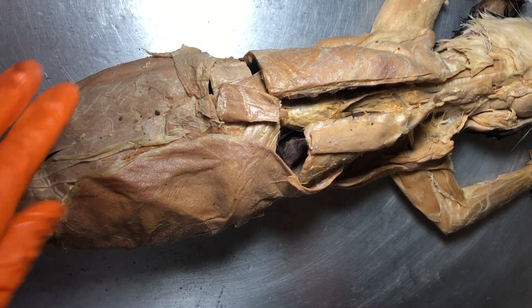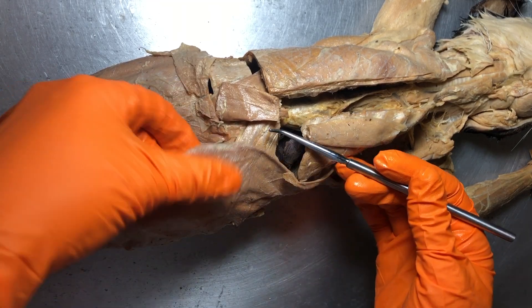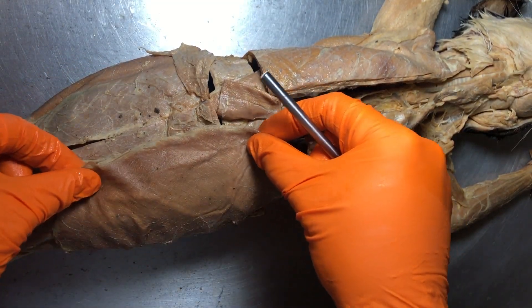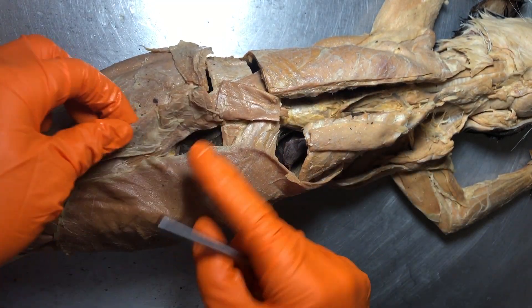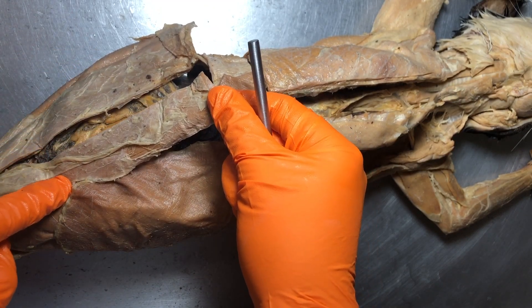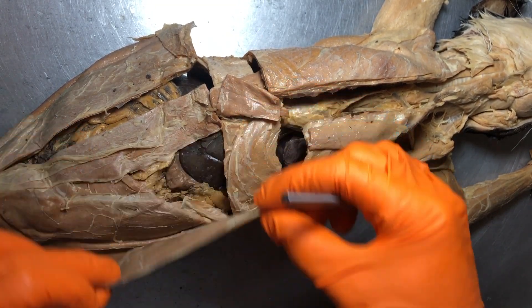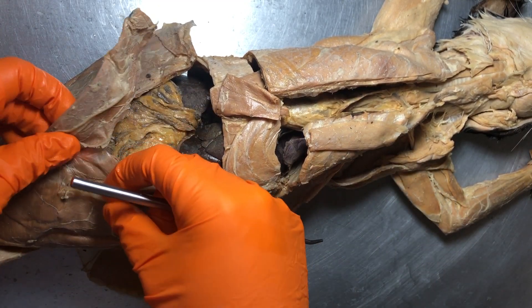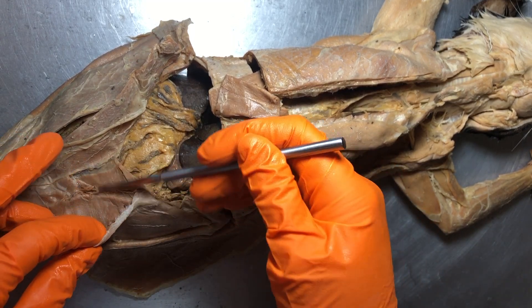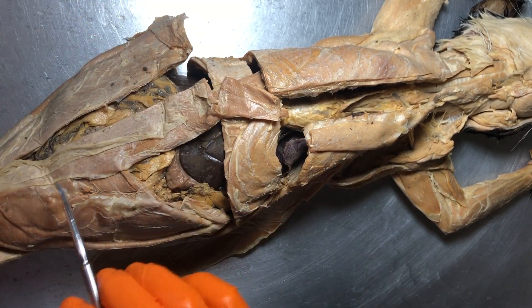This is the ventrum of our kitty, so let's look at some belly muscles. Right here we have a very large left external oblique — you can see how thin that is, but it kind of folds over like a sheet of paper. On both sides those would connect to this midline portion, which is the rectus abdominis. If we reflect the external oblique back, we have the internal obliques and then the transversus abdominis right here — think of them as running perpendicular to the rectus abdominis.